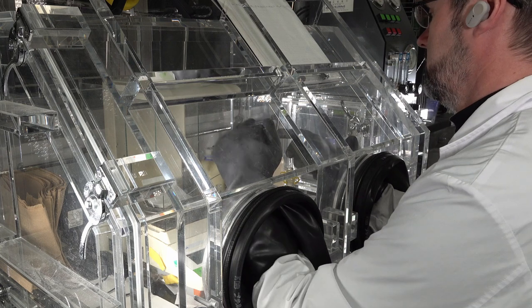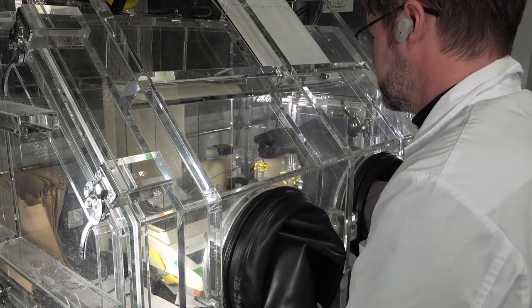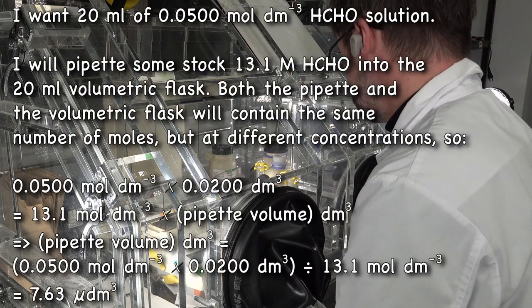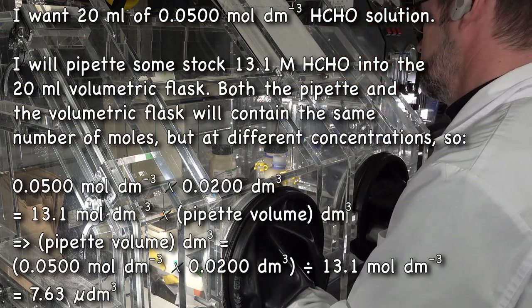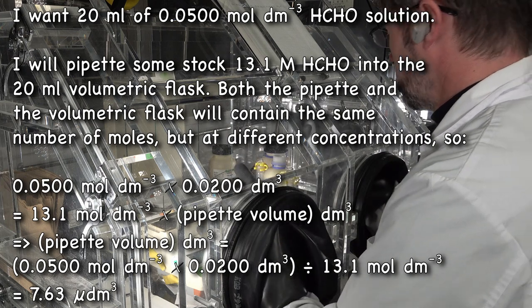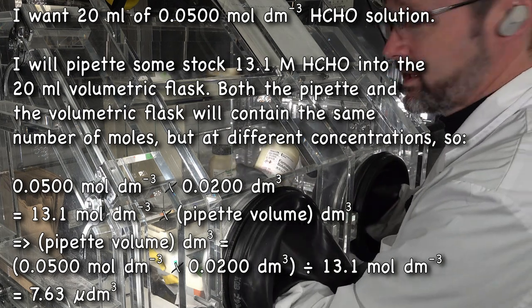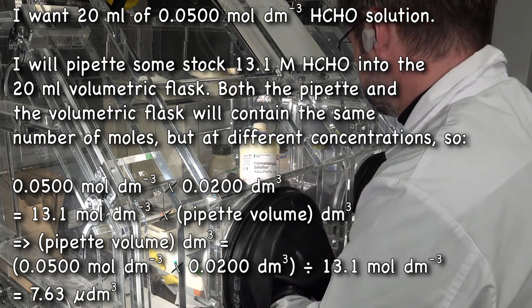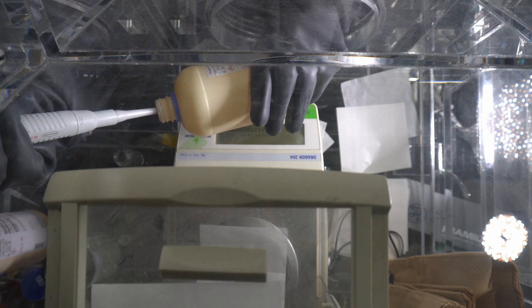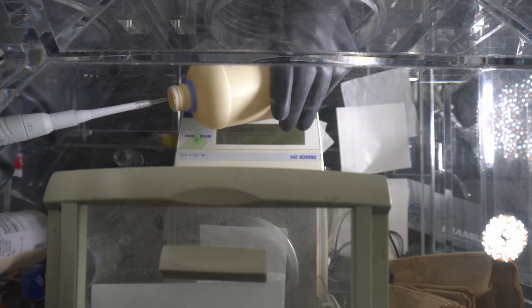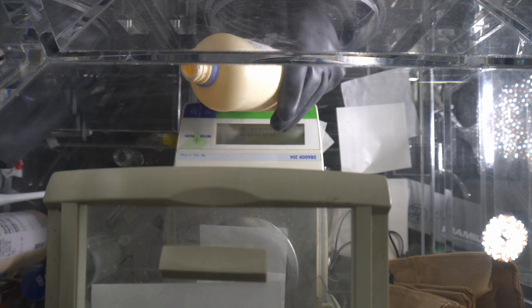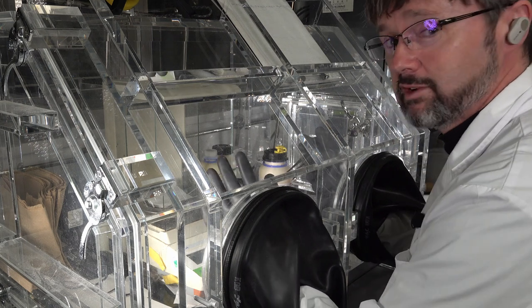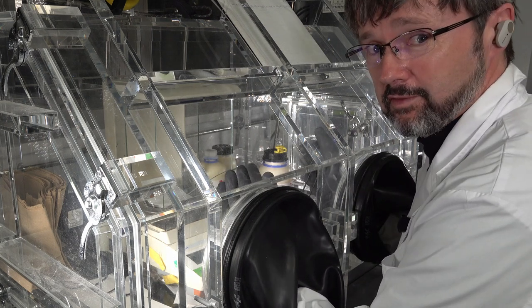And it's a great way to start. So use a micropipette. Doing this in summer is a nightmare - hands get so sweaty. This is one of the things I hate about glove boxes. I've just realized I've left a bunch of stuff out.